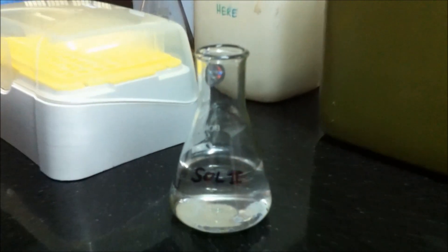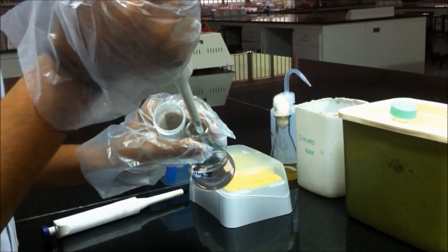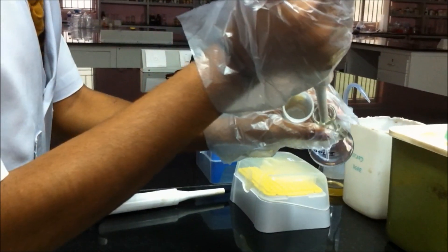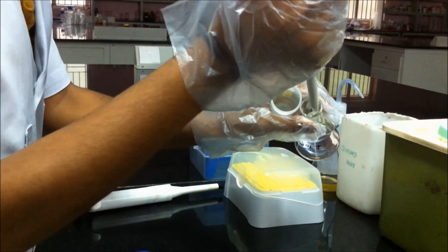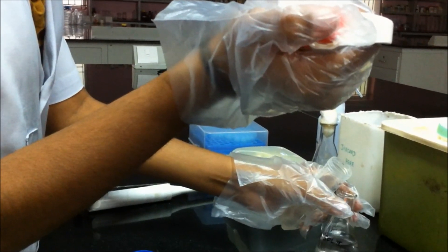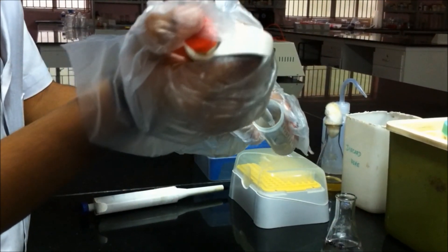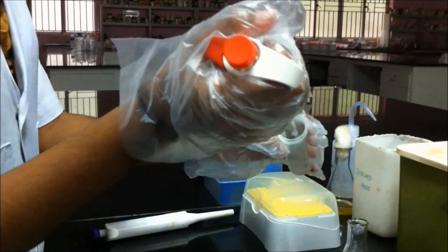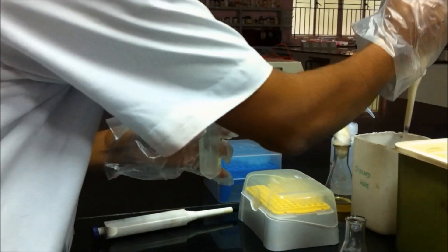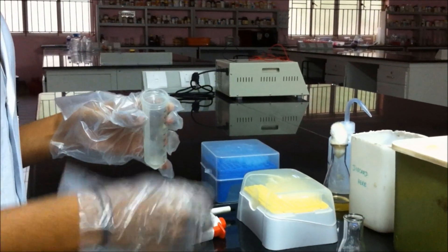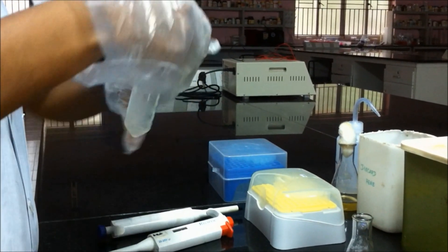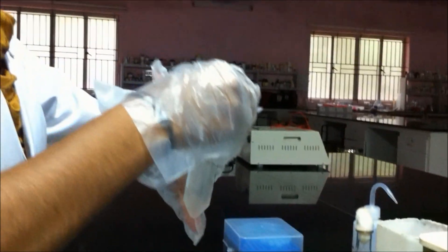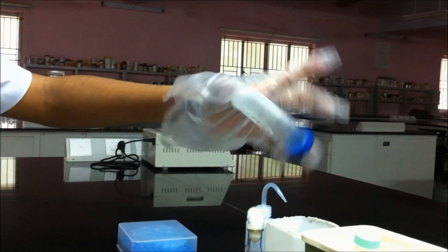Now add 200 µL of freshly prepared solution 2. Solution 2 contains 1% SDS and NaOH of 0.2 normality. Mix by inverting the tubes gently and place it in ice for 10 minutes.